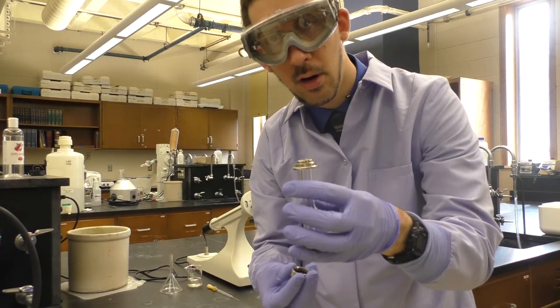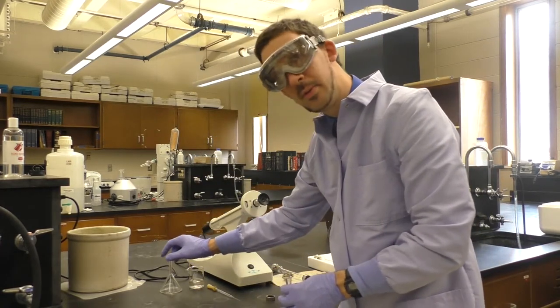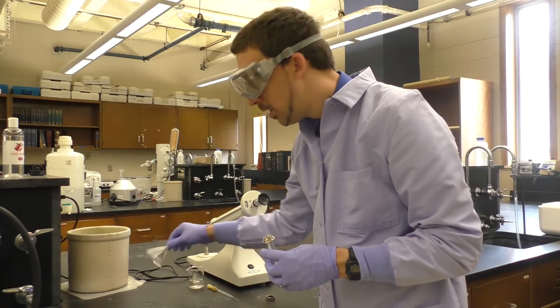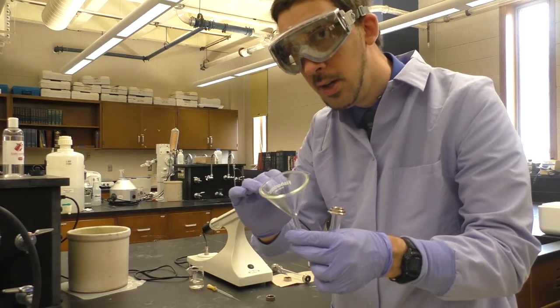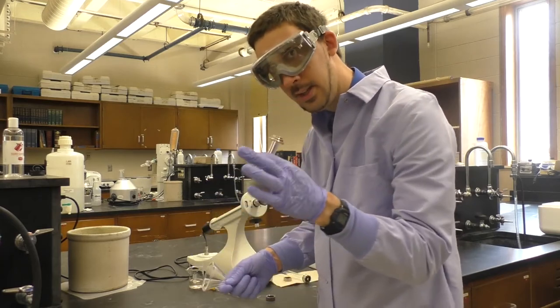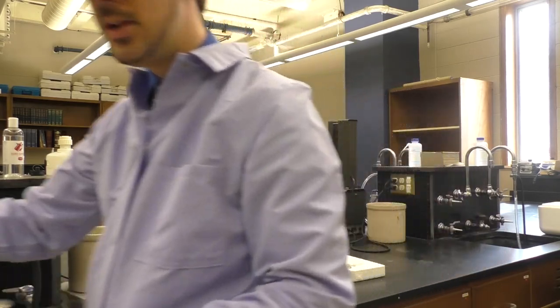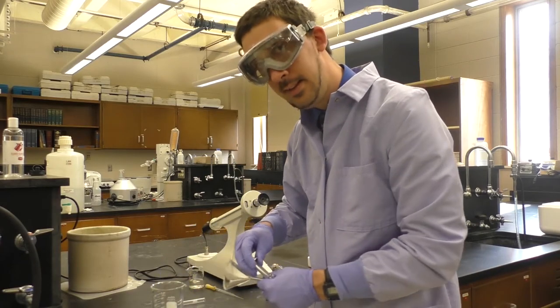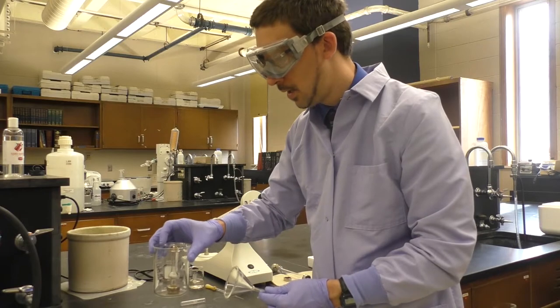This is how we would fill the cell with our solution. Now, I brought along our solution. When you go to fill a polarimetry cell, you want to be very careful because we don't want to have an air bubble. And it's going to be useful to bring along a funnel for this. I've also brought along a pipette with a pipette bulb. So first I will take this and I'll grab a beaker real quick. These are fairly expensive cells. I don't want it to fall over and break. So I'll grab a beaker, and this beaker I'll use to place the cell in, just so that if it happens to fall over, it won't fall the whole way over. It will be held upright.